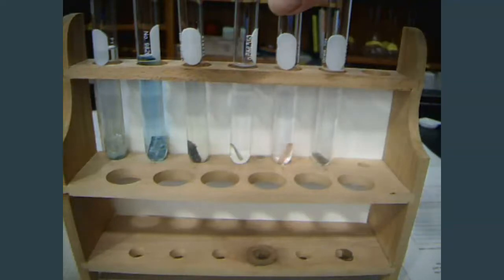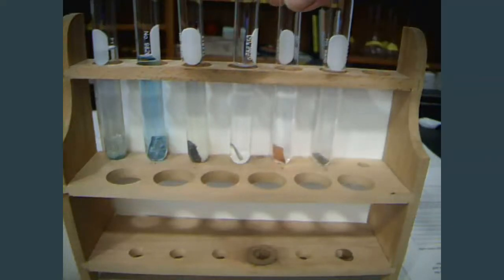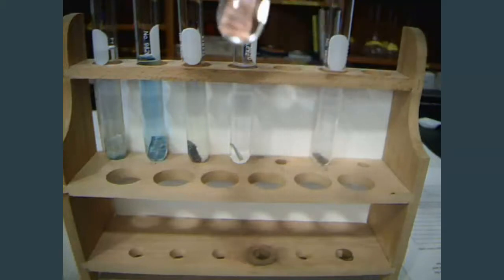And this one here, so we had copper and sulfuric acid. And so, nothing has happened in this one either, other than the copper is really nice and shiny now.